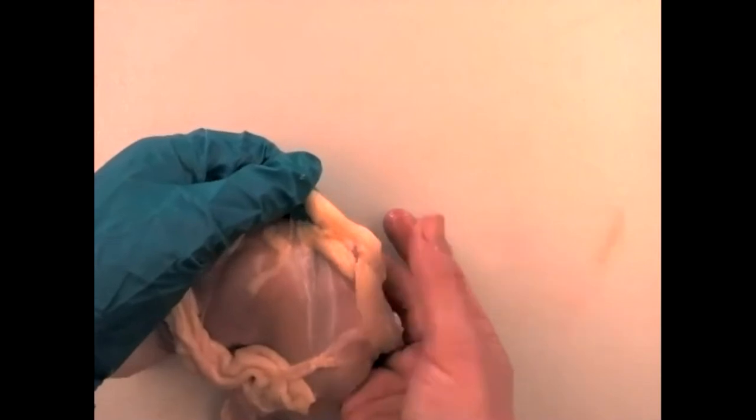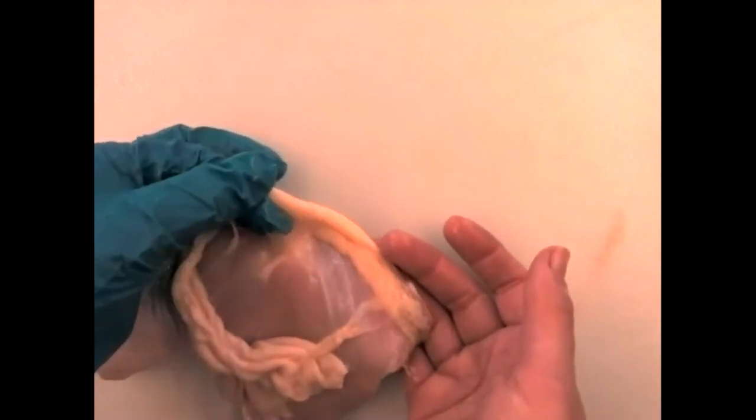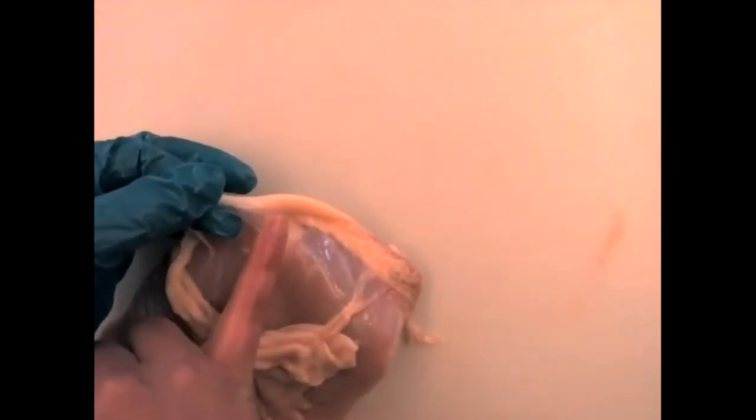The skin is not firmly attached to the underlying muscle. There is a little bit of fascia — note it's nice and clear. Chickens don't have as much subcutaneous fat as we do, so the fascia is clear instead of chunky. We can see some fat here, but it's fairly limited. This yellow tissue is loose adipose connective tissue — there's no real boundary between the adipose and the fascia; it just transitions gradually.